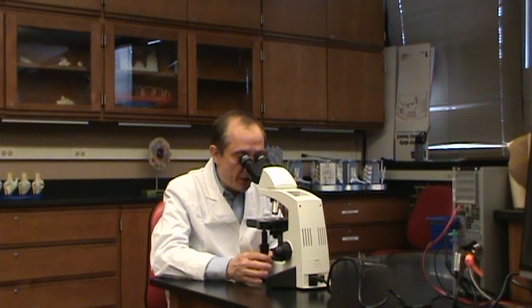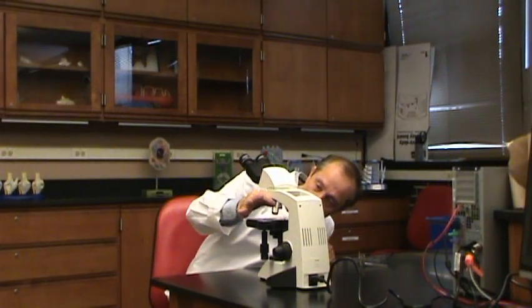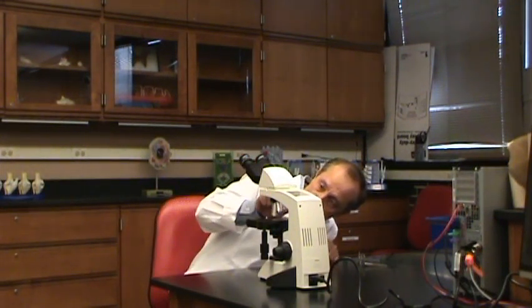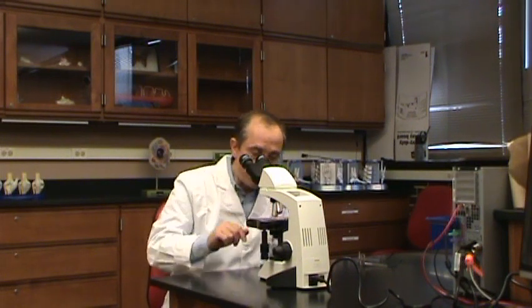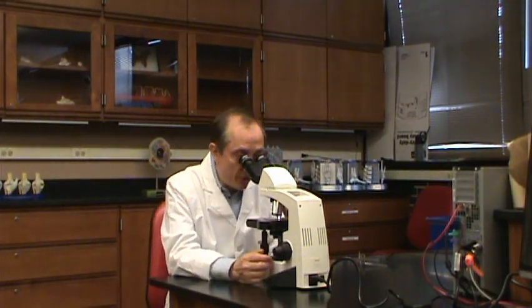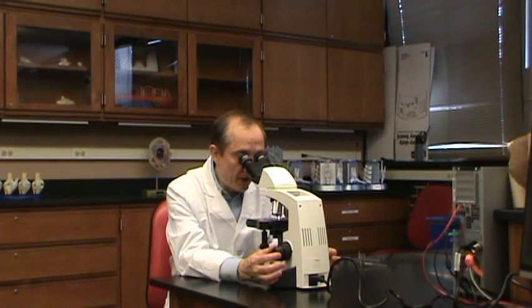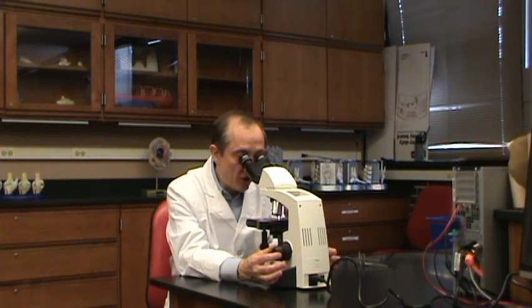Now I'm ready to go to the next power. The best way to switch objectives is to look at the scope from the side and very gently swing the objective into place. Depending on the lenses, the stage might be too high and you could crush the slide and damage the lens. So look from the side as you switch lenses. Once clicked into place, the image should be almost in focus — perhaps needing just a little fine adjustment. If so, the microscope is par focal, which it should be; if not, raise your hand and have your instructor check it.